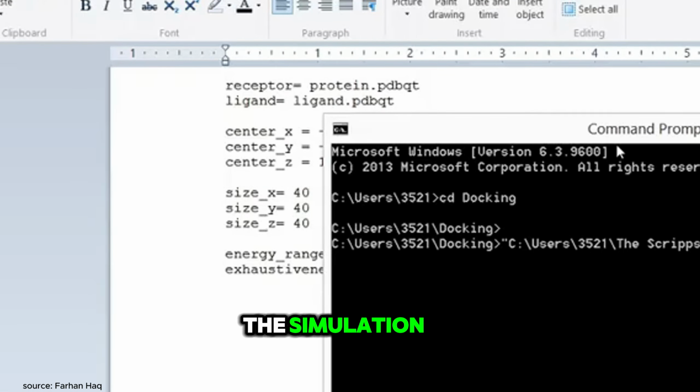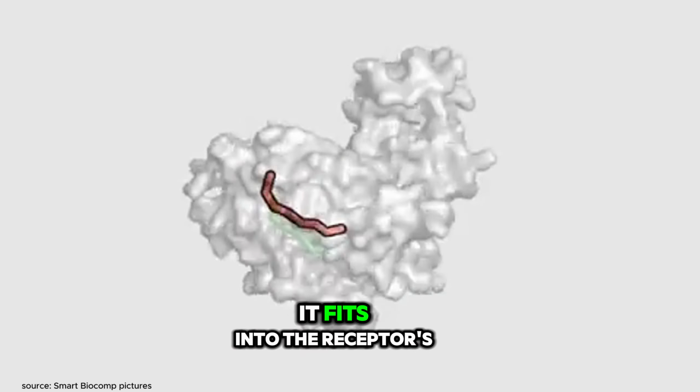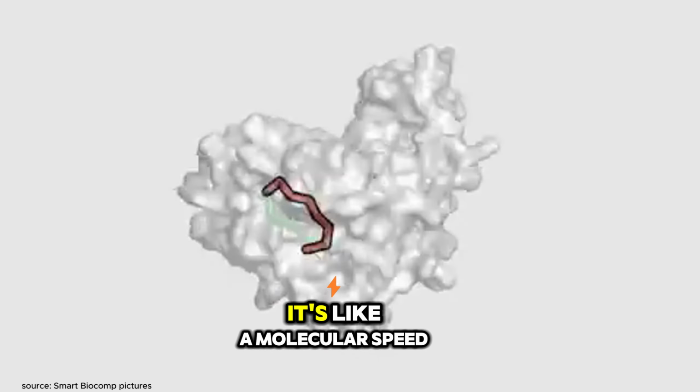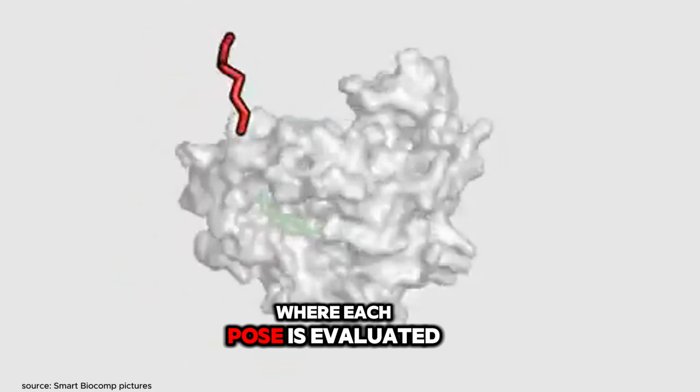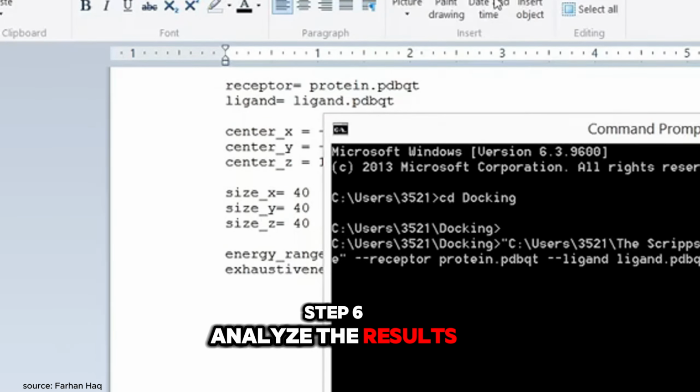During the simulation, Vina will explore different poses of the ligand, scoring each one based on how well it fits into the receptor's binding site. It's like a molecular speed dating event, where each pose is evaluated for compatibility. Step 6. Analyze the results.